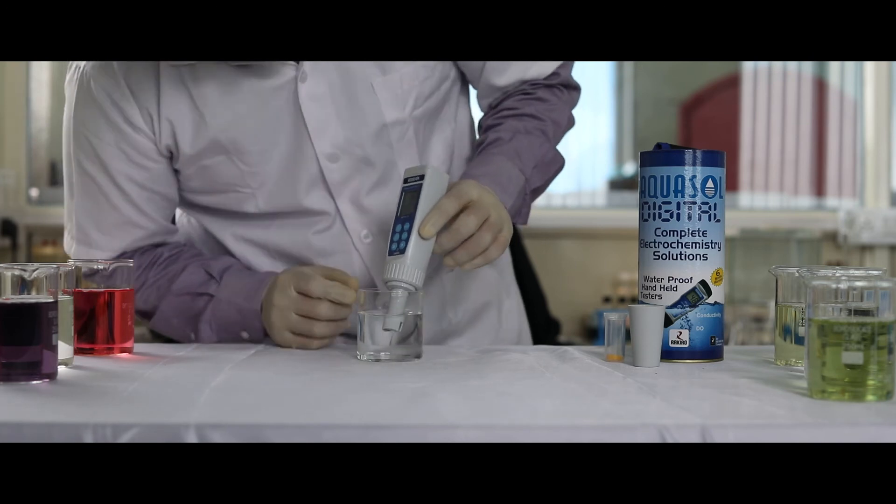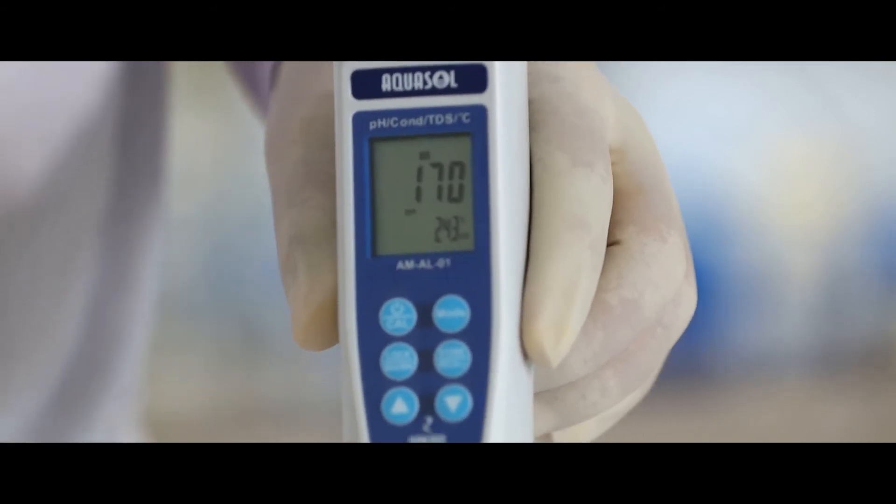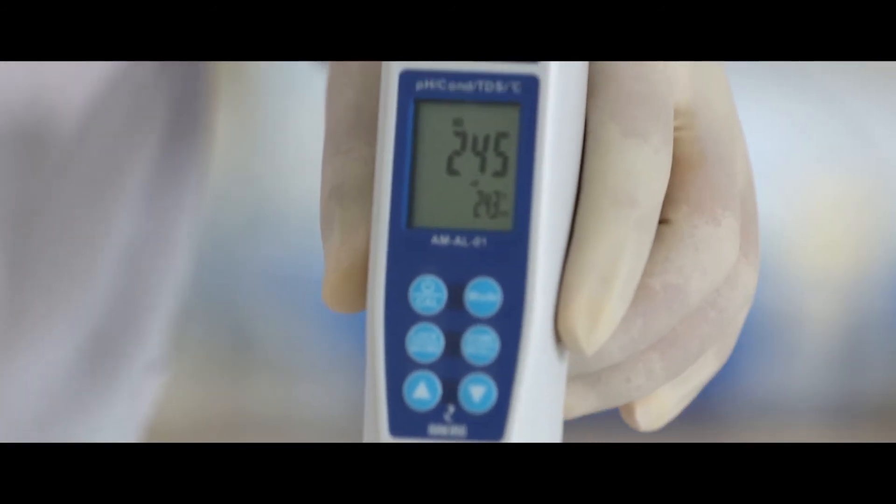Dip the electrode in the sample solution. Using the mode key, you can check the TDS, salt value and also the temperature of the sample.